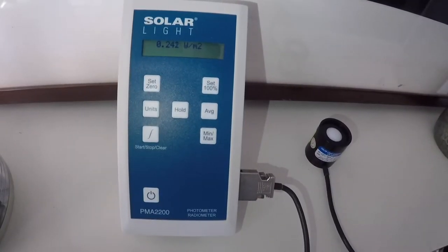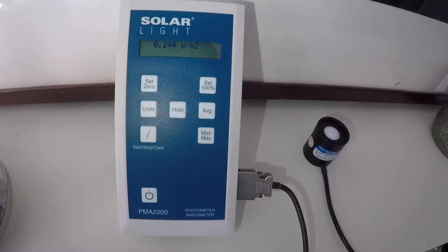Hello, this is Jean-Luc with Solarlight. Let's take a look at the PMA2200 and how to use it.